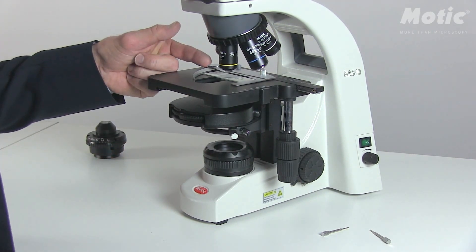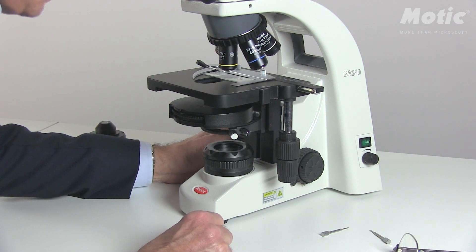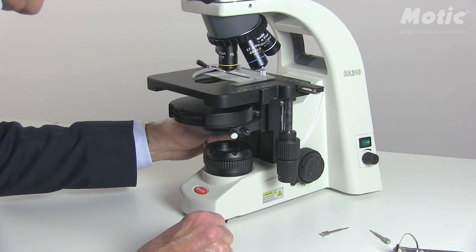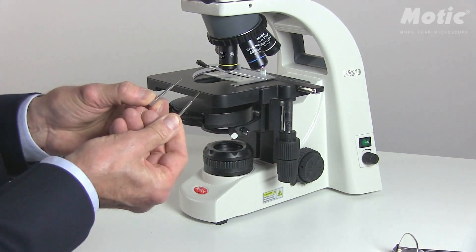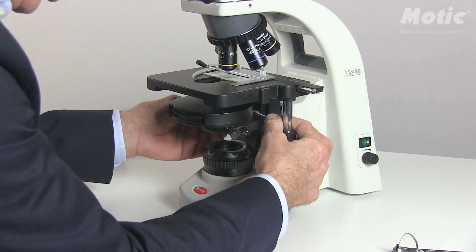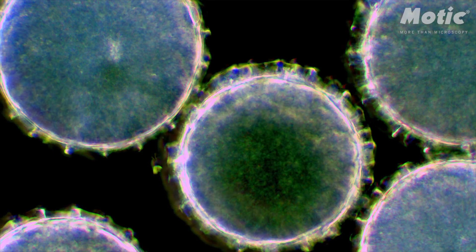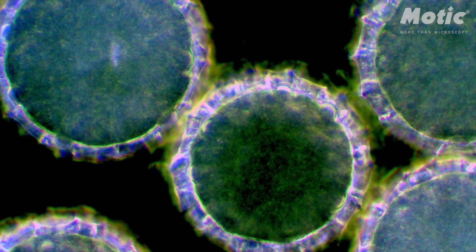Once the proper Köhler setup has been achieved, turn the condenser disc clockwise to one position so that you can read darkfield at the front. Now the central stop is in the ray path in the backside of the condenser disc. Check your sample and change the condenser height up to the point where the background is homogeneously dark. For the final setup, use the Allen keys. The centering screws are accessible from the backside of the condenser disc, from the left and from the right. Rotate and push the disc to the point where all those tiny little structures have a bright and homogeneous surrounding. Remove the Allen keys — darkfield is set up.